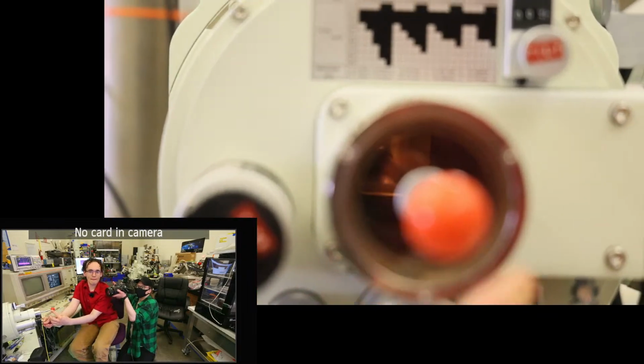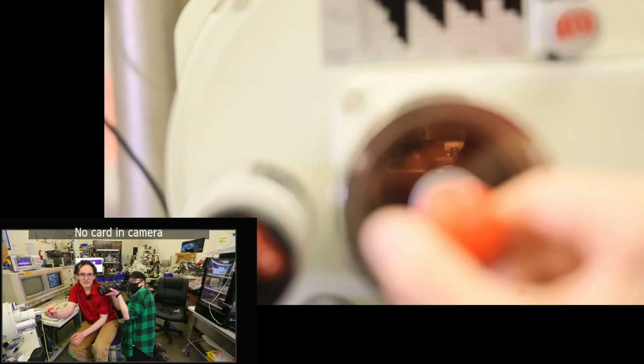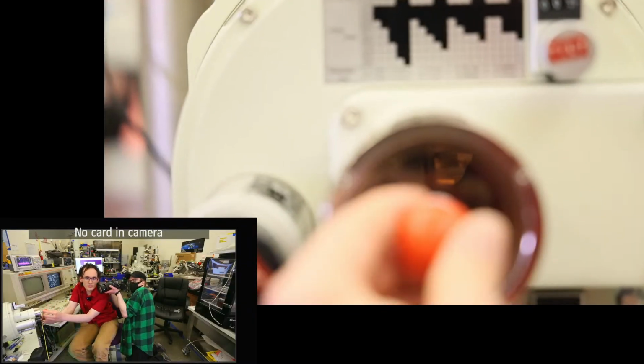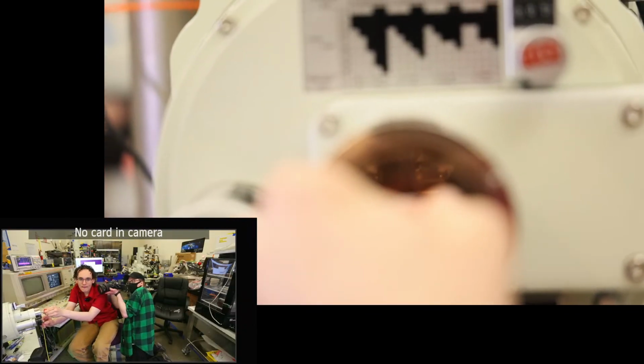I need to actually look at what I'm doing. Okay, I got to move the stage over a little bit. So just a little bit up, maybe, or I guess down. There we go. Okay, I can kind of see what I'm doing through the camera. So moving the stage over to line it up, and then we're going to thread into it. Oh, I'm going to come up actually and do the lower one of the holes. That'll be easier, I think. Oh, not rotated correctly. That explains a little bit. There we go.